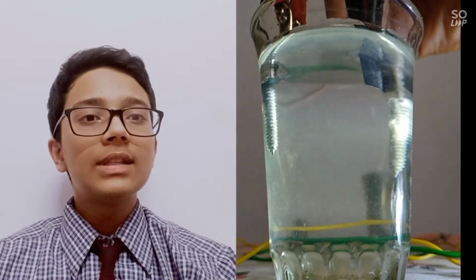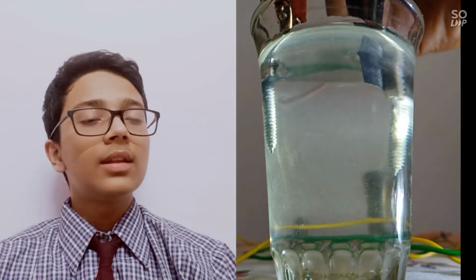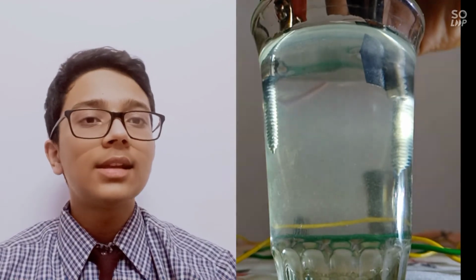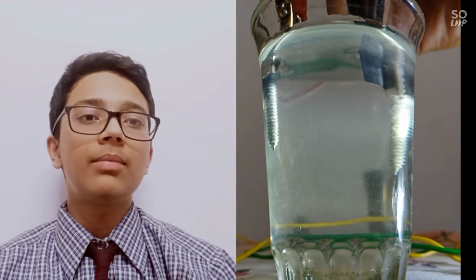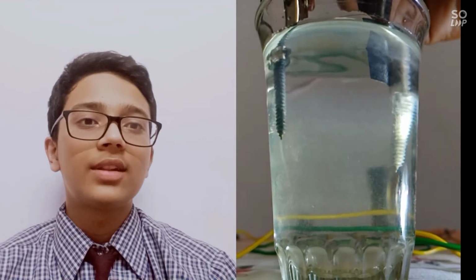Here again we see hydrogen bubbles at the cathode. What's the reason? The reason is simple. Even though their concentration is less than Na+ ions, H+ ions gain electrons more easily than Na+ ions. That's the reason they are discharged at the cathode and not the Na+ ions. Now, see the anode. What do you see at the anode? There's not much difference. But wait for it, you will know what the difference is.